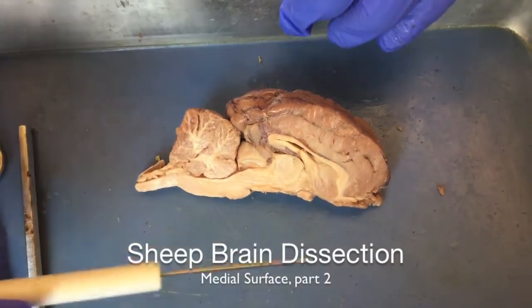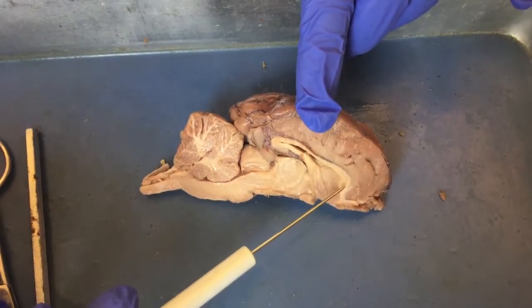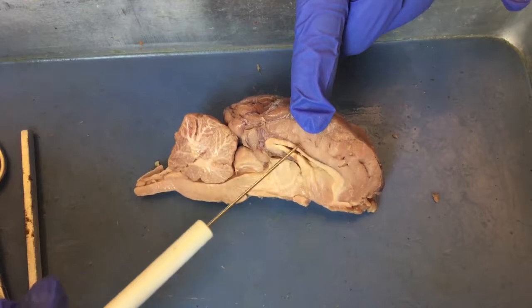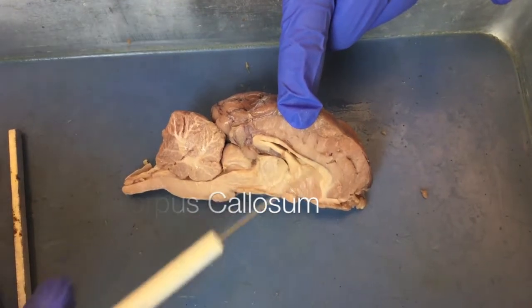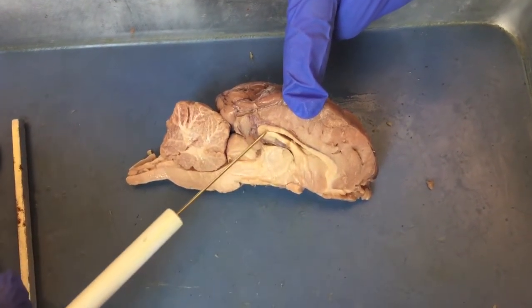Let's identify some features going anterior to posterior. Located here, we have a massive band of white matter. This is called the corpus callosum. This is a tract of myelinated axons that connects the left hemisphere to the right hemisphere. This is the corpus callosum.